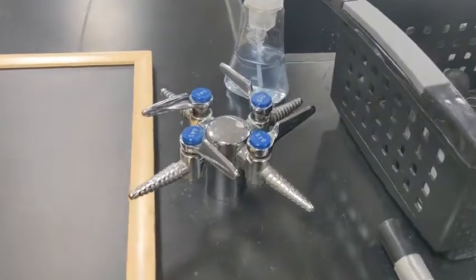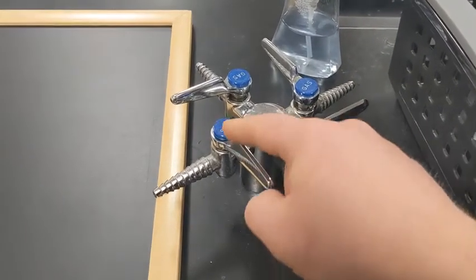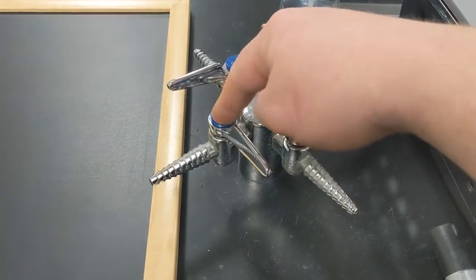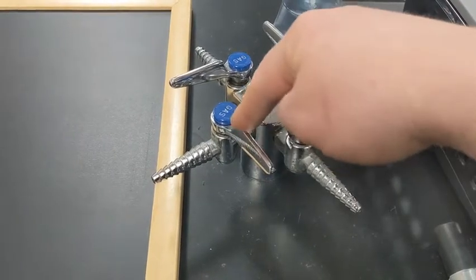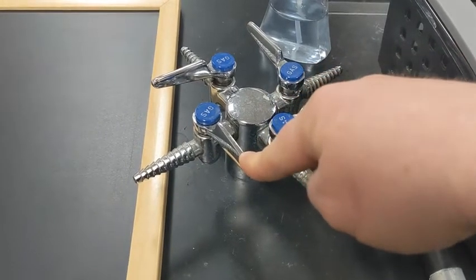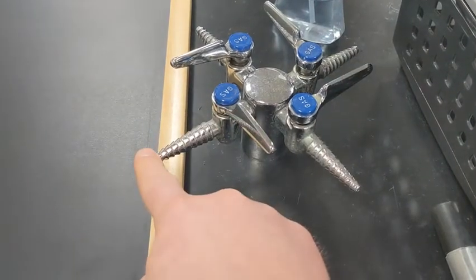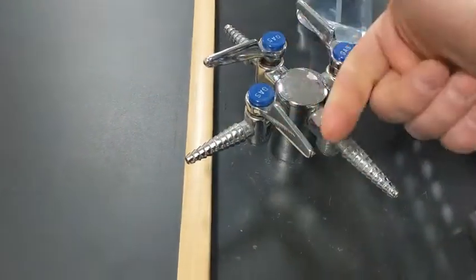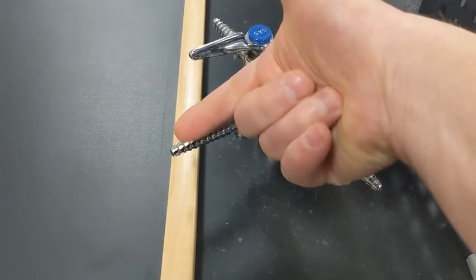Here's where we're going to connect our gas. The valve inside here is what we call a ball valve. The way that the handle is pointing is the direction the inside of that valve is pointing. Right now it's pointing away, so that means this is closed. If we crank this so it's pointing this way, then it is open.